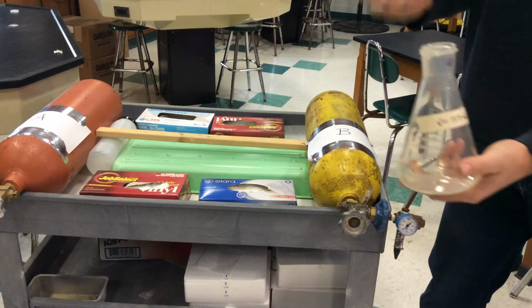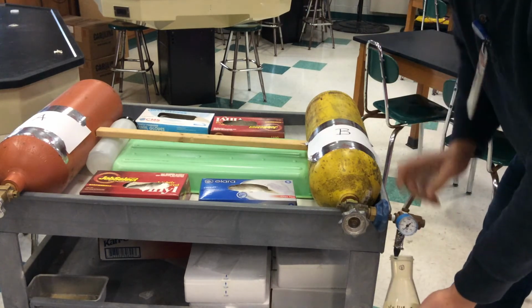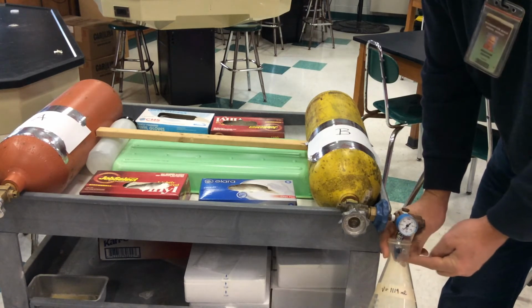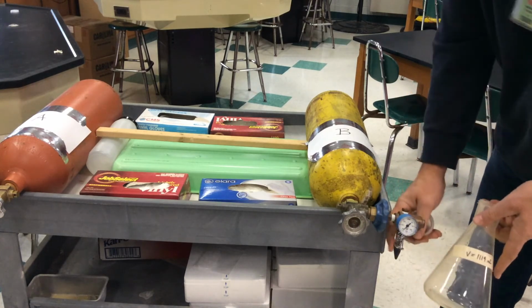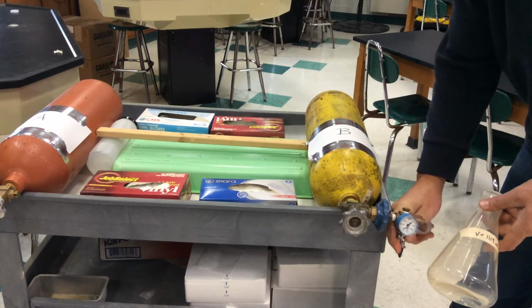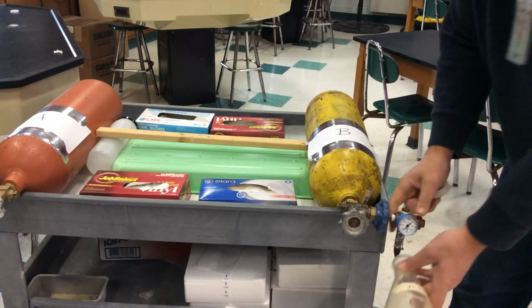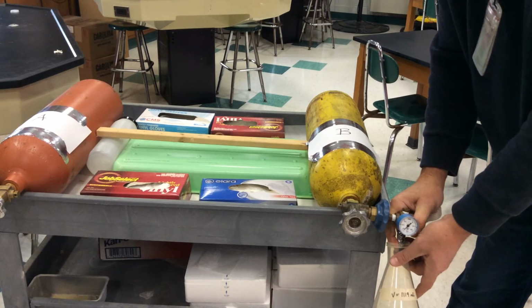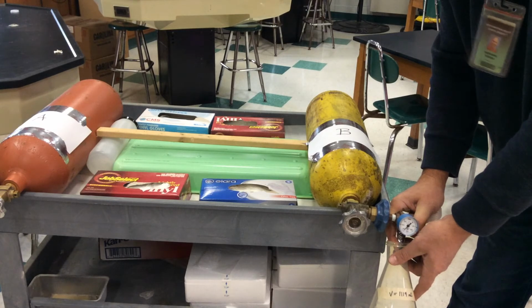Take my flask, keep my top handy. This time though, I'm going to go below, and because this gas is more dense than air, it's going to fill the bottom of this flask, and of course, it's going to displace the air out. For the same reason, it has the same balloon valve, all I'm doing is just pushing it one way or the other. There's no one way to push the valve. So in any case, it's on, and I'm going to flush it out. Wait about 15, 20 seconds or so, just to make sure you got all the air out.